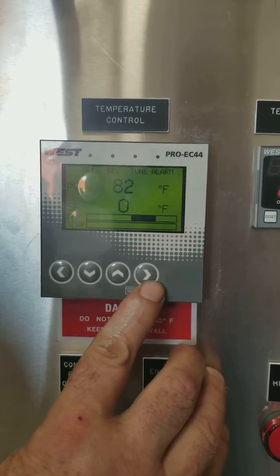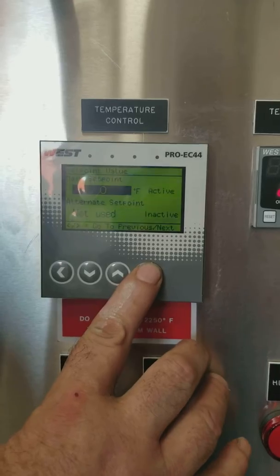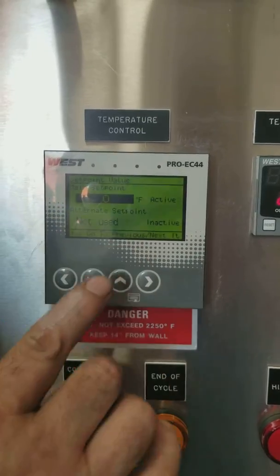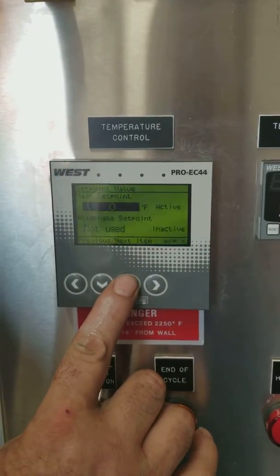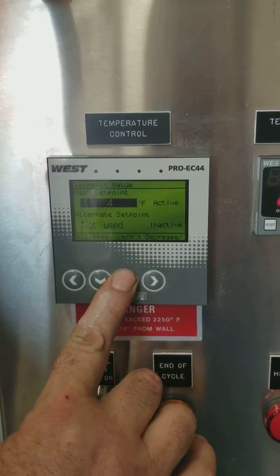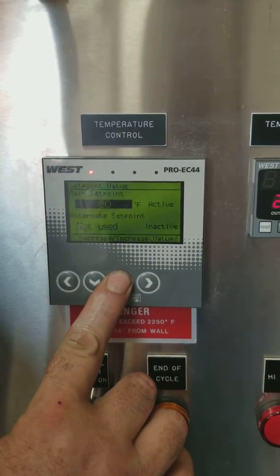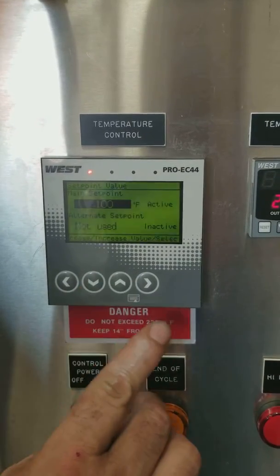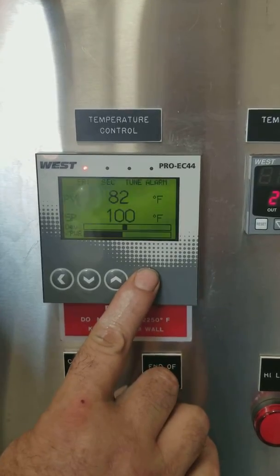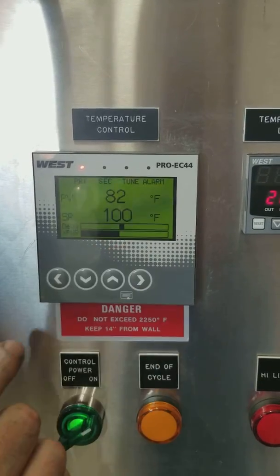To change the set point, press the right arrow two times. You'll see it says 'Main Set Point.' Press the up key — in this case, we'll set it to 100. Then press your right arrow to confirm. There's your new set point.